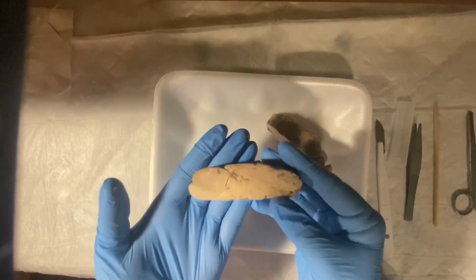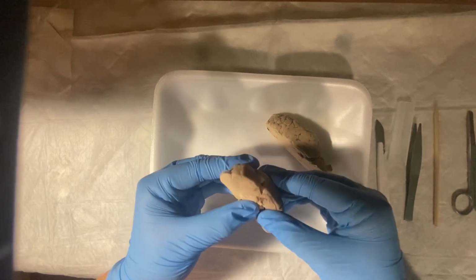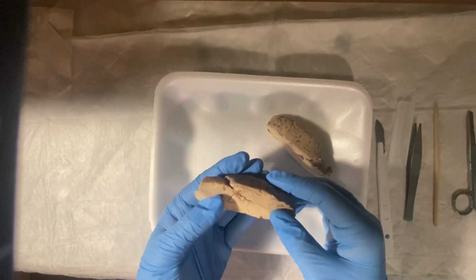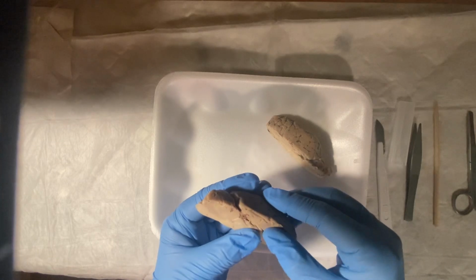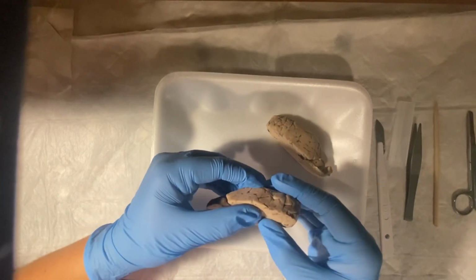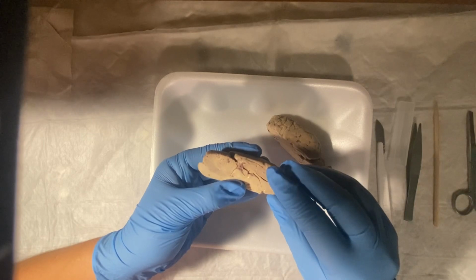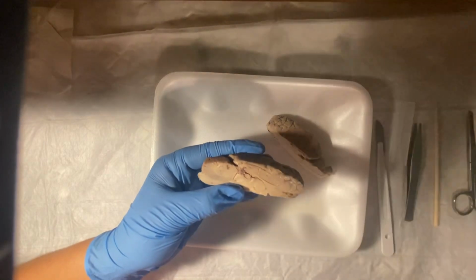Okay, now I'm going to point out the ventricles. Mine is very flat. Okay, let's try to squish it out a little bit. So the ventricles are the fluid-filled spaces in the brain, and they're filled with the cerebral spinal fluid, which is what cushions the brain, kind of protects it. And so we've got the lateral ventricle. Mine's very squished.